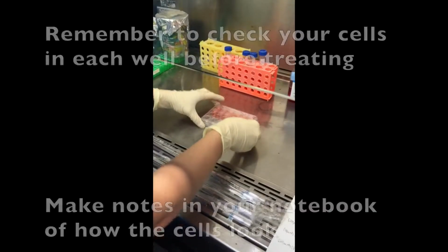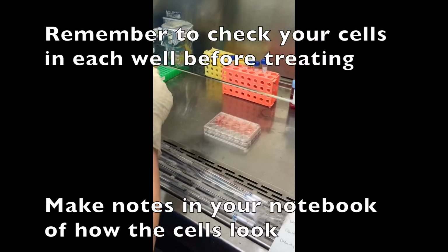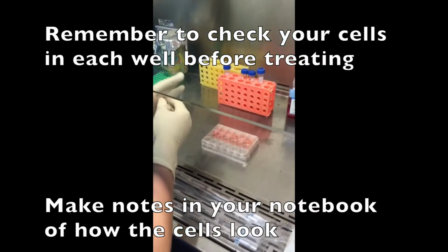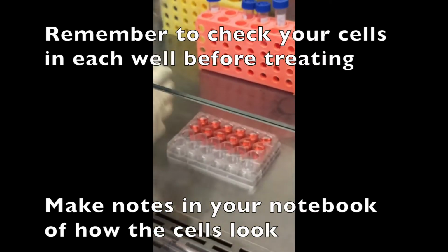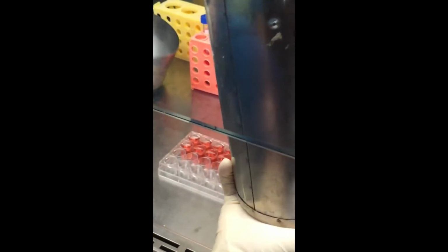So I just took my plate out of the incubator and I already looked at each individual well under the microscope and made notes about how confluent the cells are and if there's any noticeable differences. So I'm going to do one treatment group at a time, which is 3 wells.